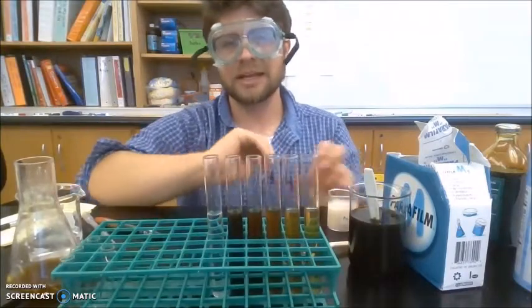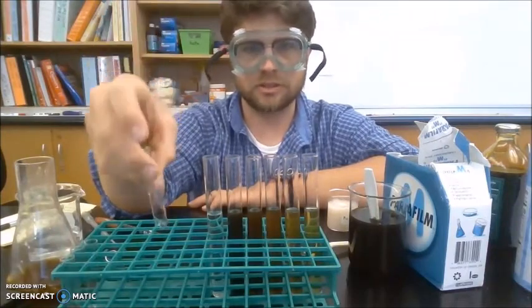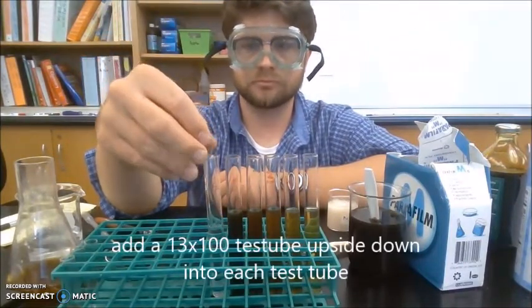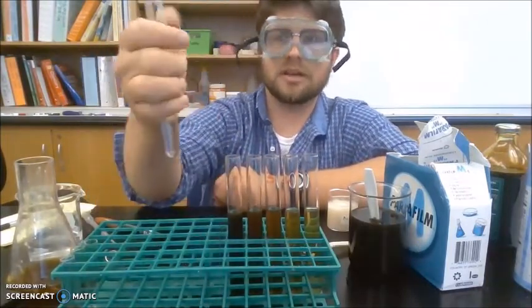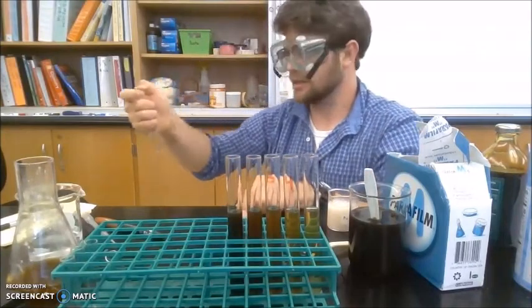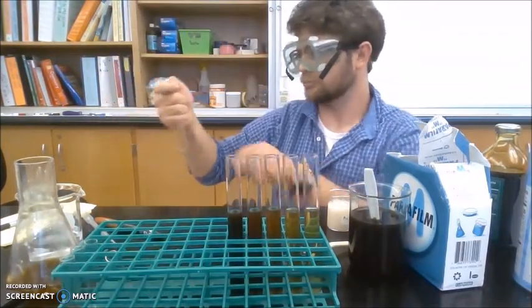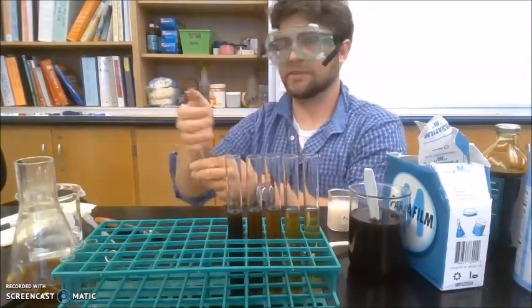Now, I need to add this smaller test tube. Now, I want to add it not face up, face down. And I do not want any air bubbles. So right now it's sticking up. So to make it so that there's nothing but liquid inside of that tiny test tube, I flip it over. So you can see that it went down. You might have to do it a few times.